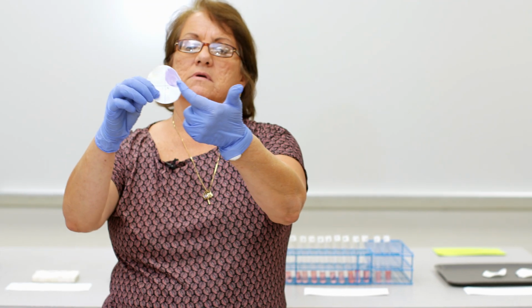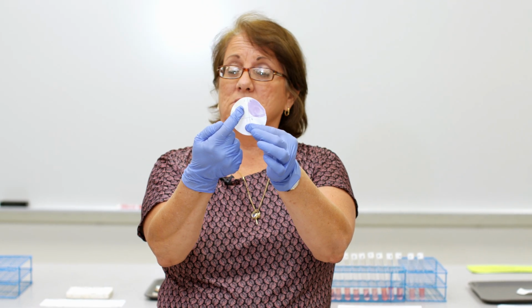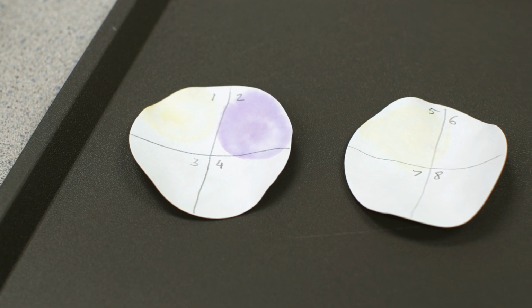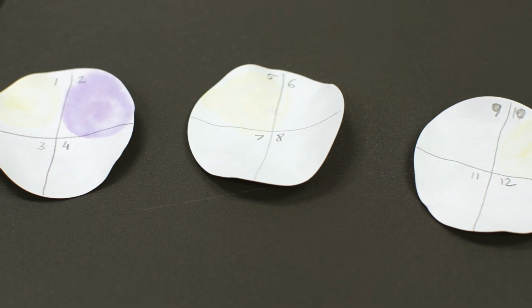And over here you have the ninhydrin test. Also, you can see that here's an unknown that's positive. Okay, it's a purple color. And here is an unknown that's positive. It's proline, the only one that gives you yellow. These others are negative.